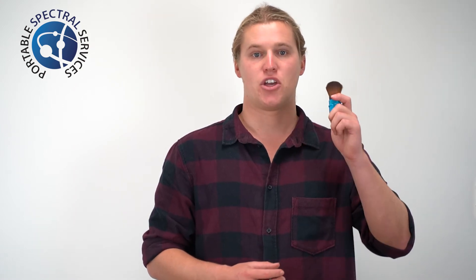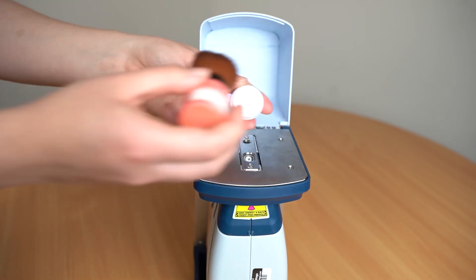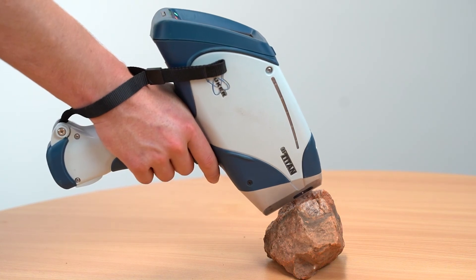To avoid changing the windows all the time, you can utilise a small cleaning brush such as this. You can also invest in quality CRMs to monitor contamination so you have real results and do not need to guess when contamination has built up. You can also be gentle when analysing potentially rough surfaces so as to not pierce the window.